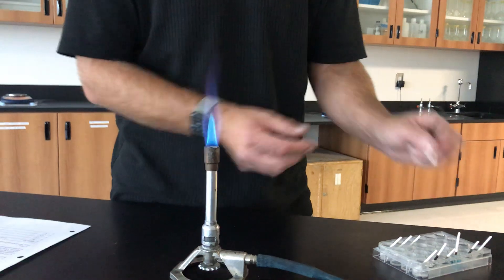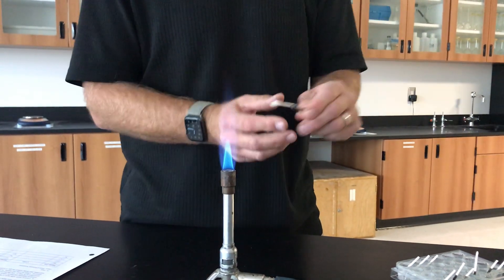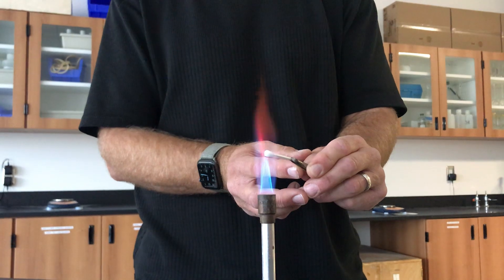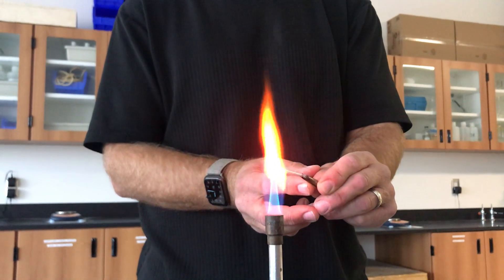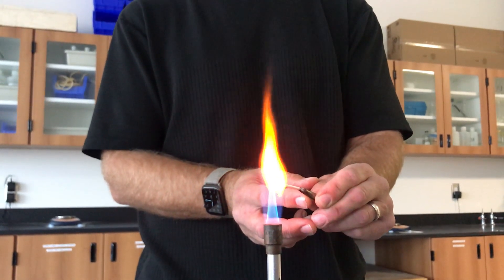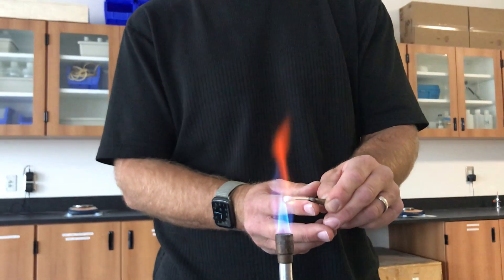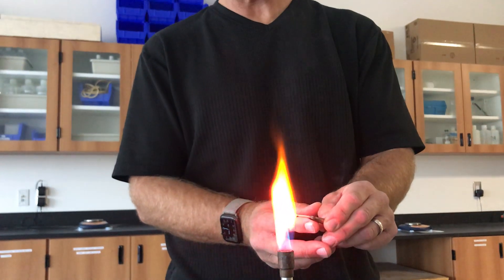And then the final metal ion that we will flame test is strontium. And that's a great flame test for strontium. Maybe one more dip for you — and there's our strontium flame test.